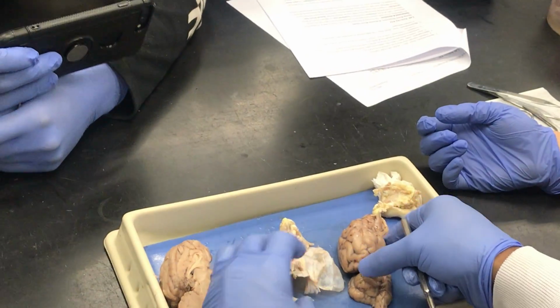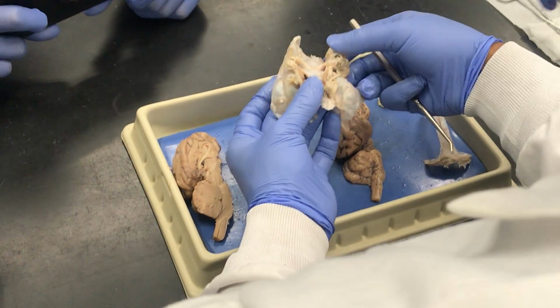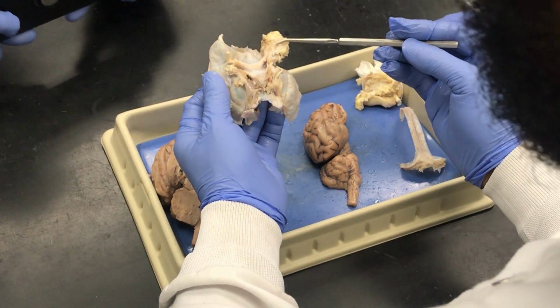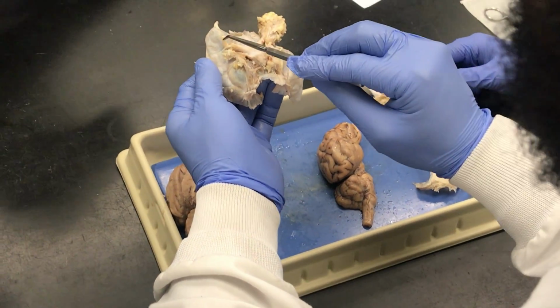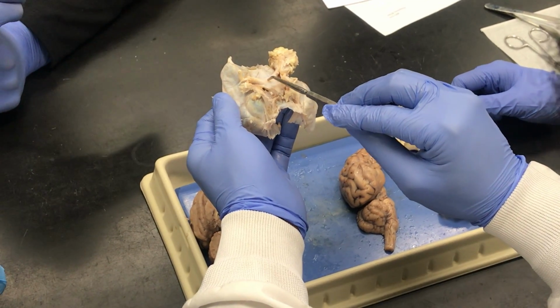Okay. And then it jumps to the optic chiasma? Optic chiasma. Optic nerves. So you can see the lump of fat here. This used to be some of the adipose that cushion the eyes. This side, the fat I just trimmed off. So you can see the optic nerves, the two optic nerves. And where the two optic nerves come together in the medial section, that's the optic chiasma.